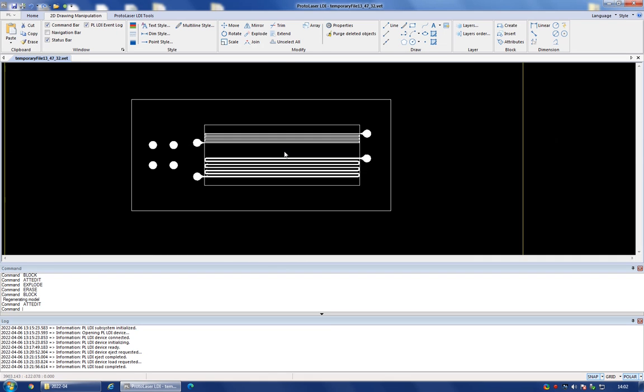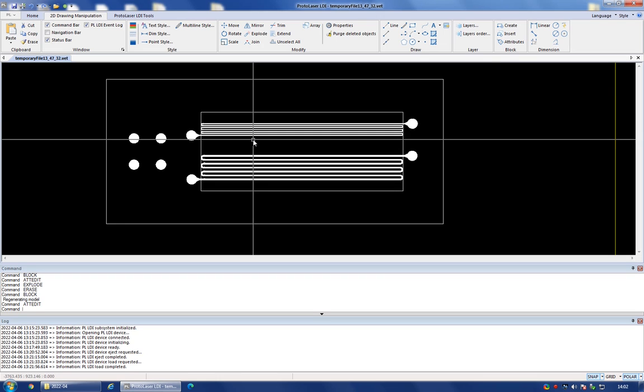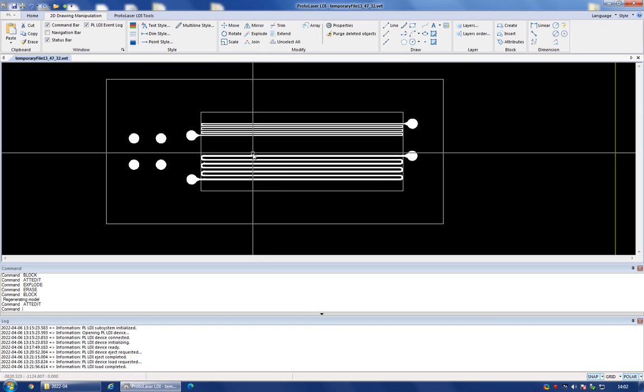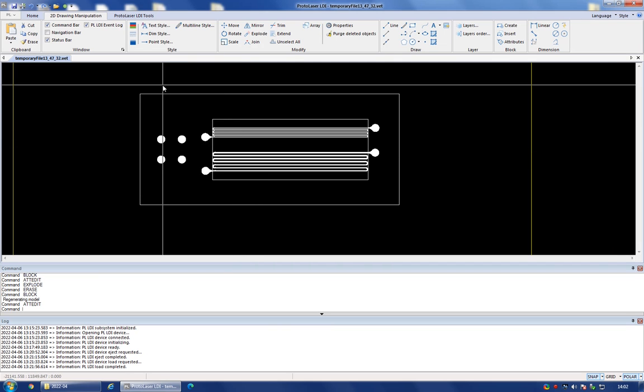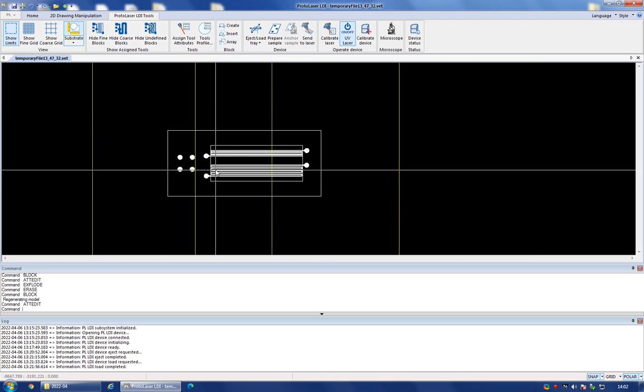The final thing I have to be careful about is that I position the structures within the area of my sample. So the software will not tell you if you don't do this correctly, but it has a way to help you to see where you're supposed to put the structures in the first place. So if I go on this Protolaser LDI tools, and I go on the substrate section, and I select the rectangle 75 by 25, this is the normal glass slide, and you'll see that that is positioned vertically.